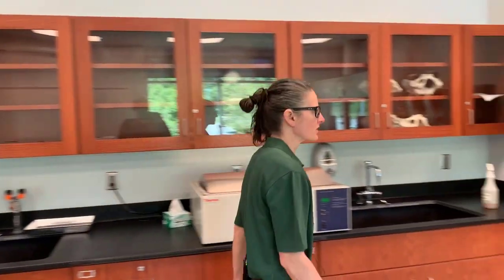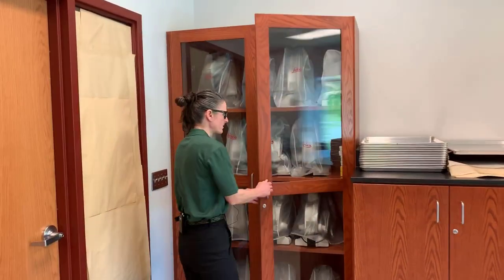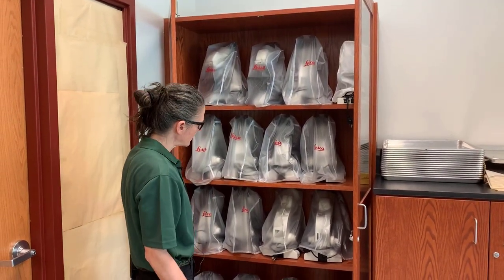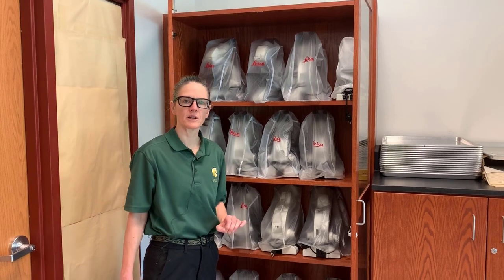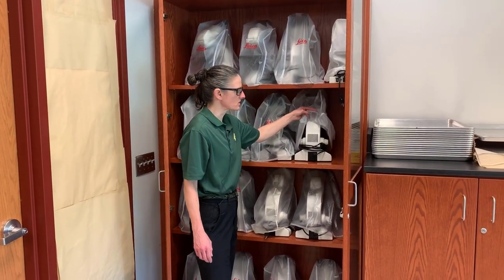Today we're going to talk about the proper use of the microscope. The microscopes in most laboratories are either at a dedicated workstation or in a cabinet. When we get the microscopes, you will notice that they are under a dust cover.